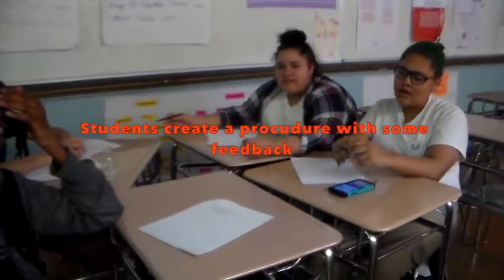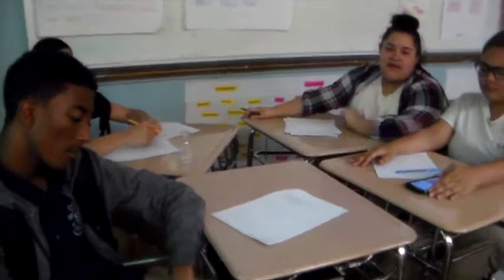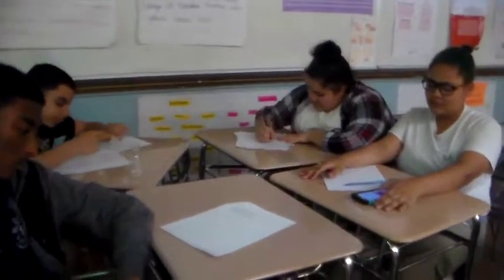When do you think it goes in? I think it should show it. Why? Because when we have the base, if we put the indicator after the base, we won't know exactly when it changes. So then we would put the acid, and then the indicator, and then the base drops. Sounds good.